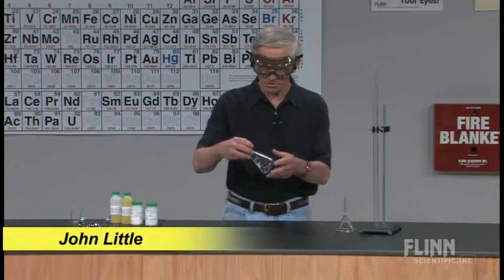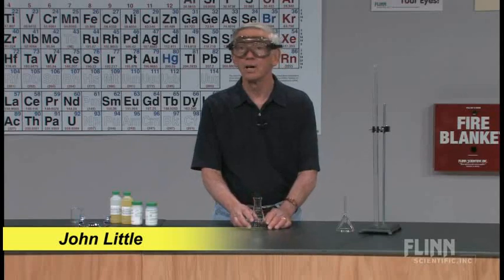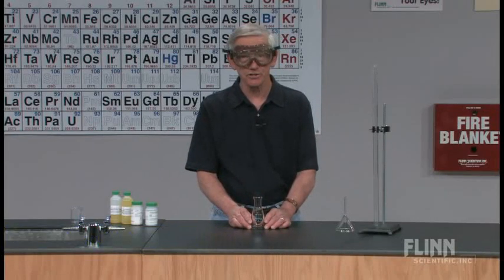We're going to take a look at a demonstration this morning that's variously called Redox Rainbow, Goddess of Beauty.